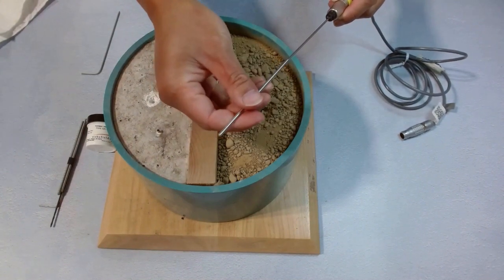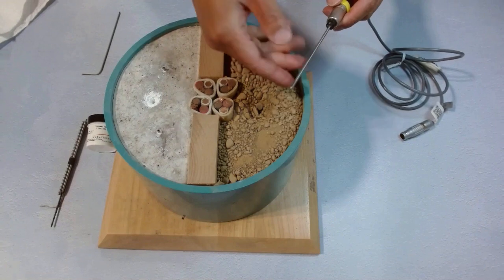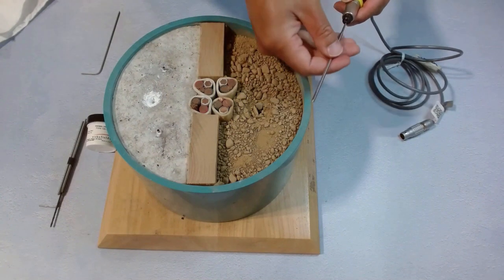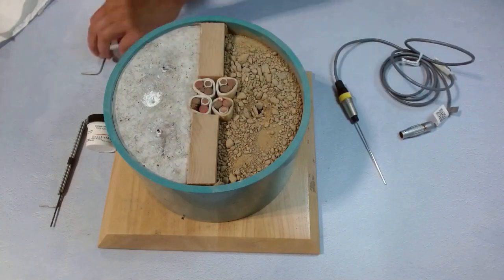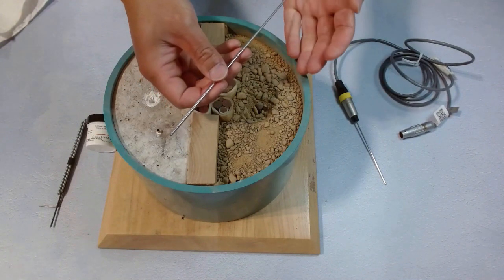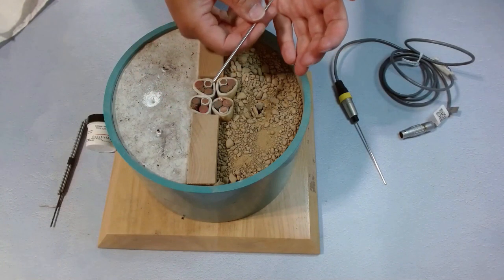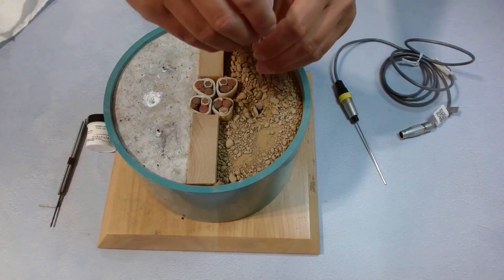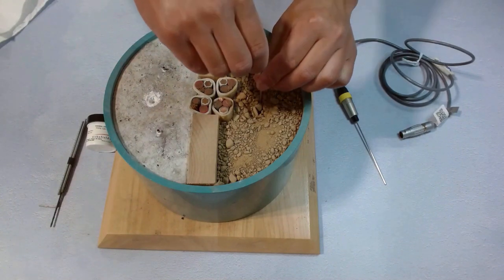This needle sleeve is just the right size to put the TLS100 needle tube in there. Now we take the L-shaped poker rod, insert it into the needle sleeve, and we push it into the earth.